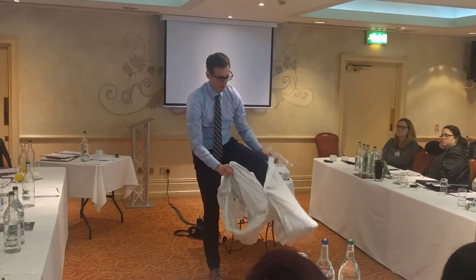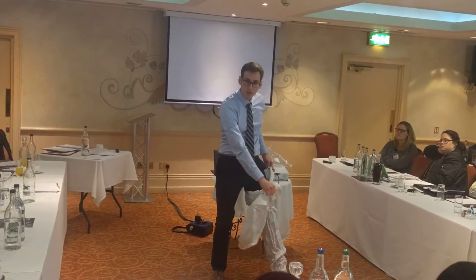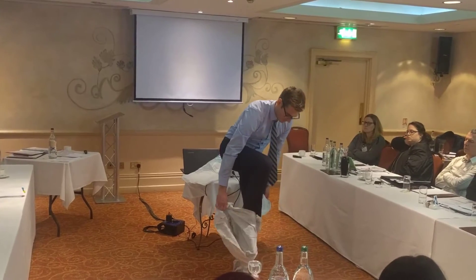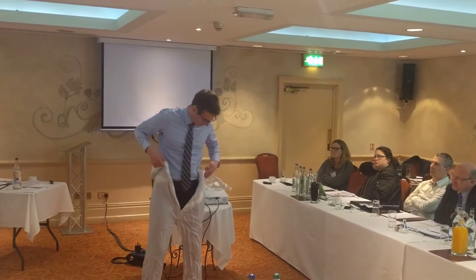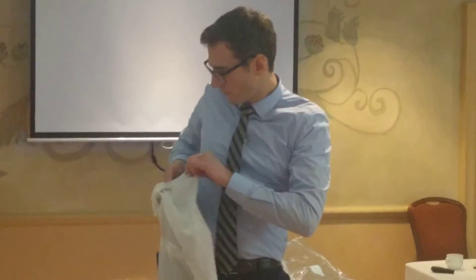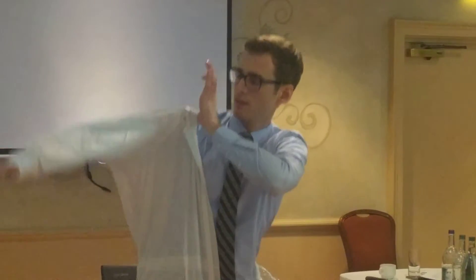It's quite a comfortable solution. I'm protecting the collar quite well because this is the inside of the overall. Then bit by bit it's unfolding and I can really take control of what happens with the collar, which is a critical area once I enter the clean room.